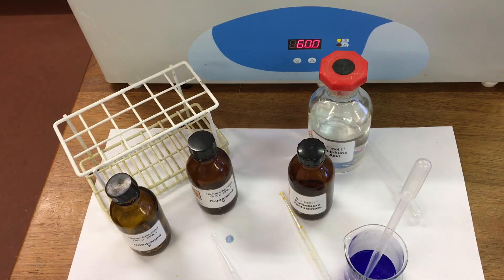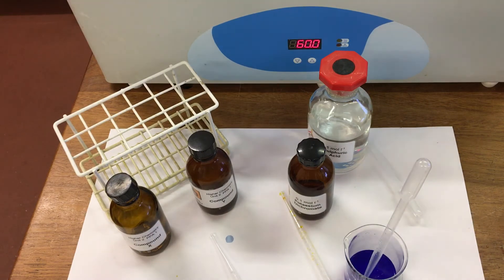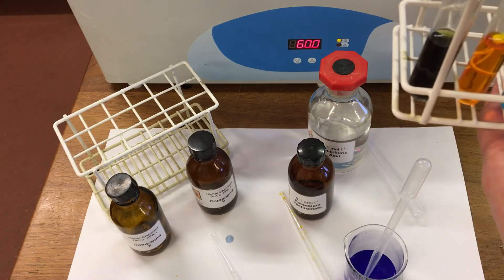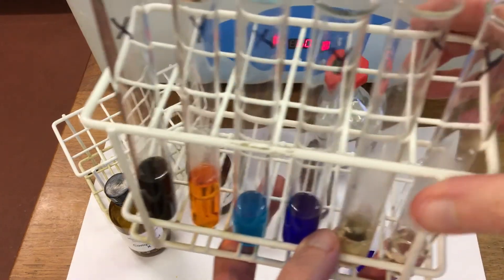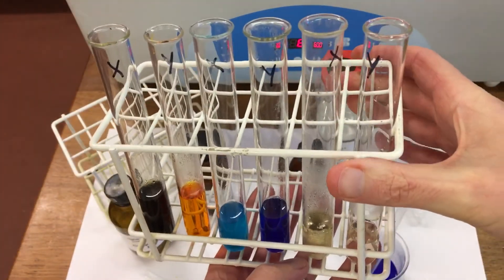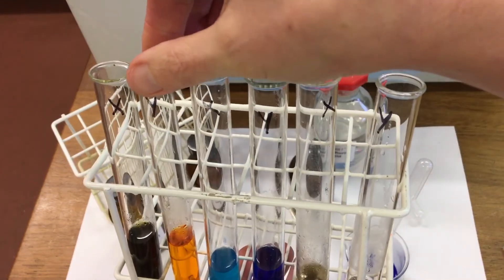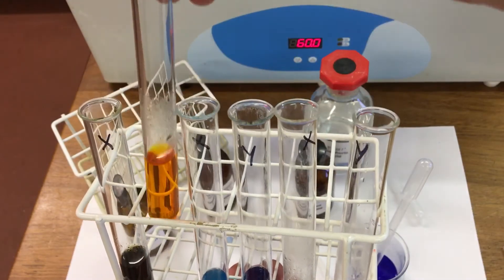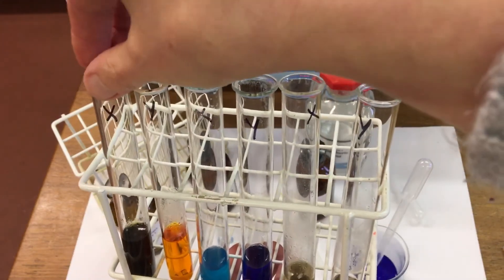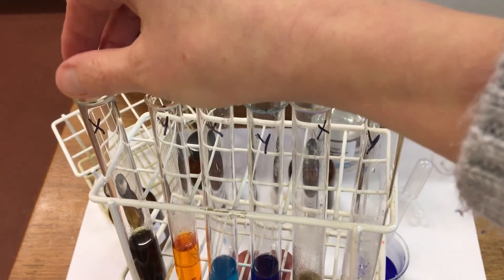After a couple of minutes we're going to have a look and see if we have any color changes in our test tubes. Looking at our results: for the first solution, the acidified potassium dichromate, we can see in test tube Y there's no color change — it stayed orange. In X we've got a greeny-brown color, so this one has oxidized.